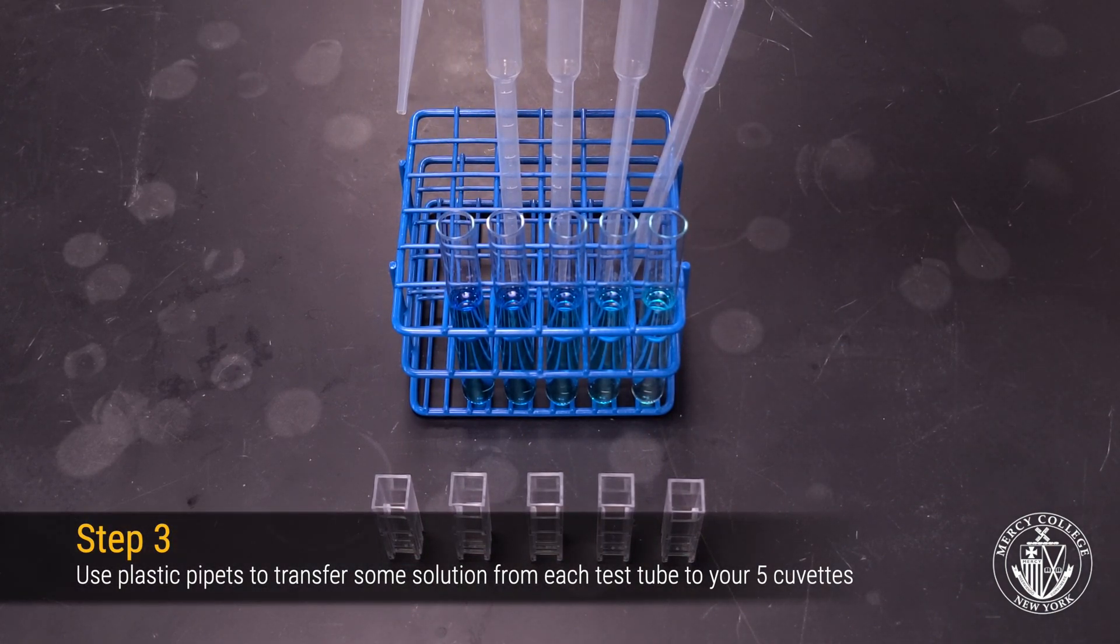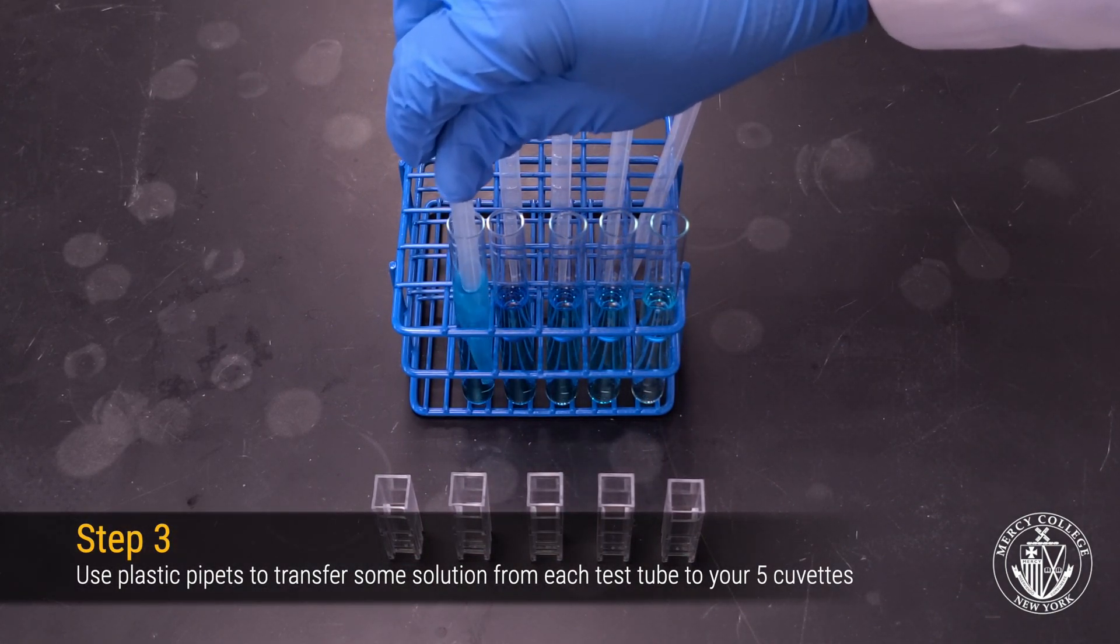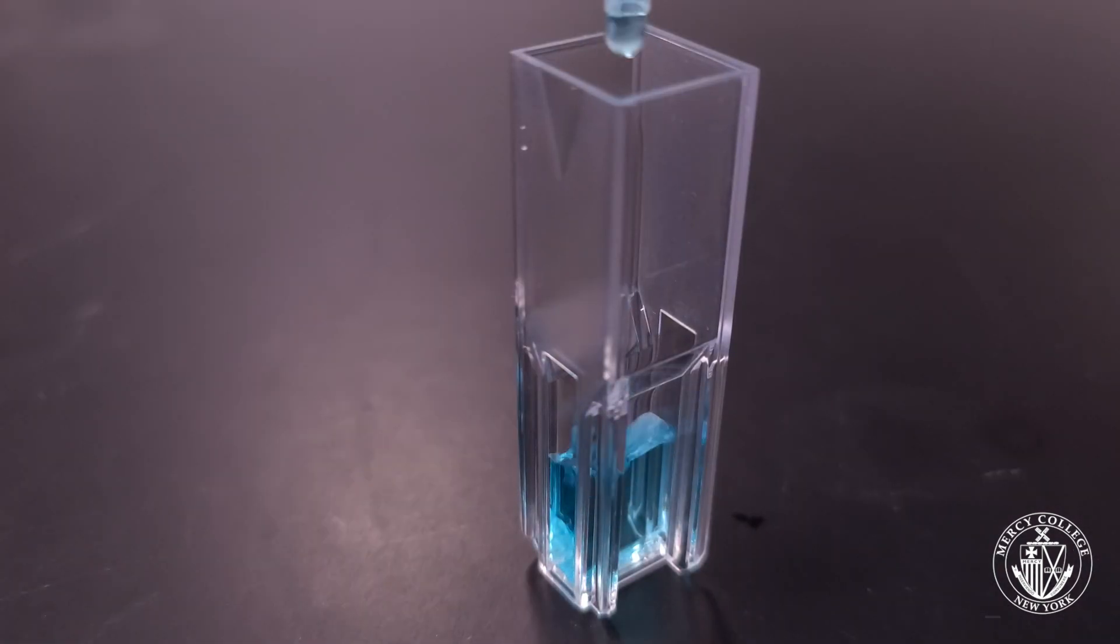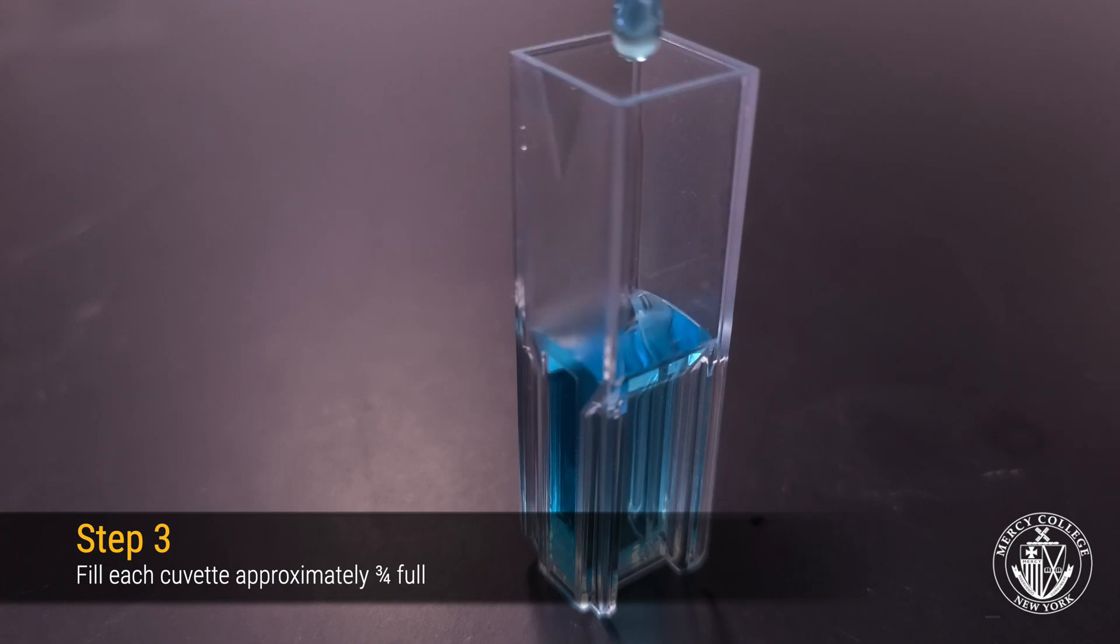Using plastic pipettes, transfer your standards to cuvettes. Try to fill each cuvette at least 2 thirds to 3 quarters full of solution.